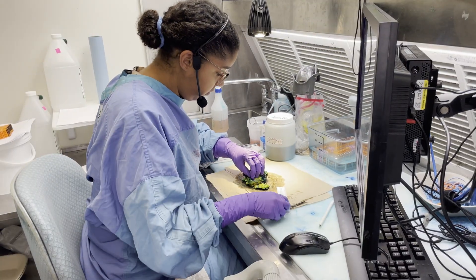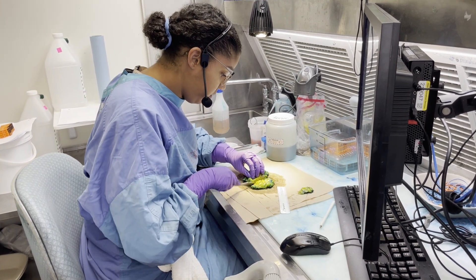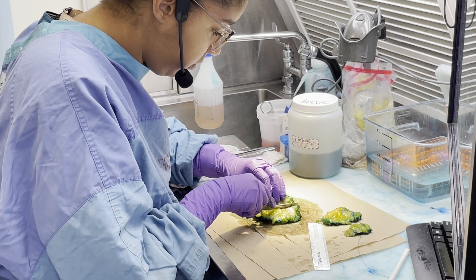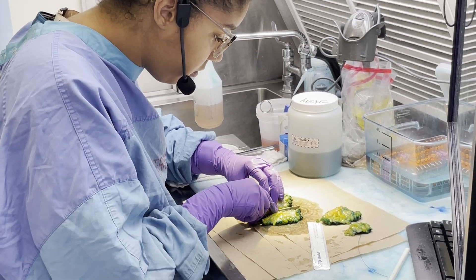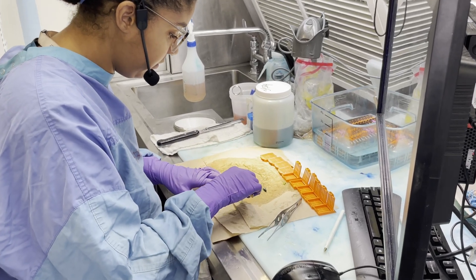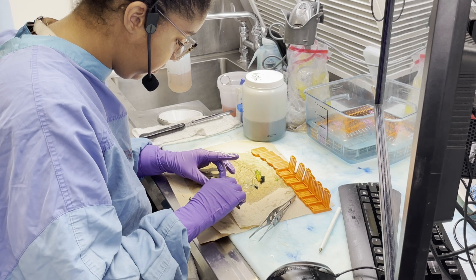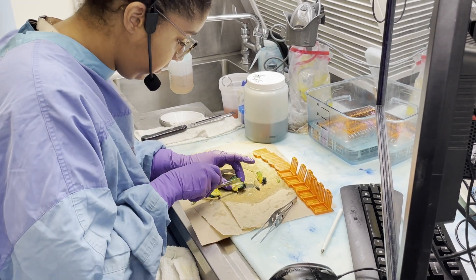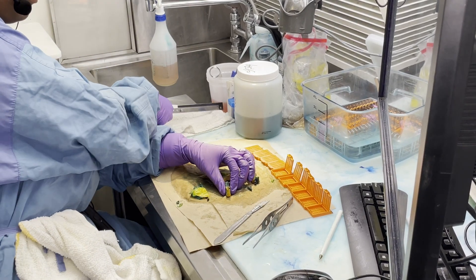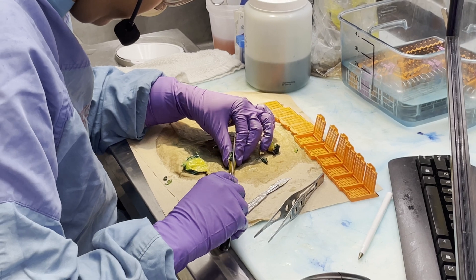After inspecting the outside of the tissue sample, the pathologist assistant slices the tissue into thin sections so that any abnormalities on the inside of the tissue can be better visualized. The pathologist assistant then selects tissue to be examined under the microscope. The selected areas of tissue are cut into small sections and put into the previously created cassettes.